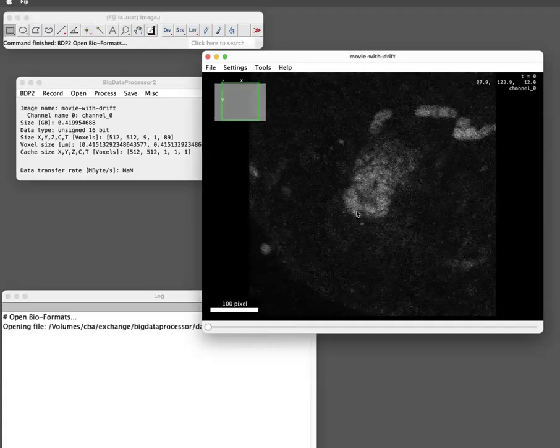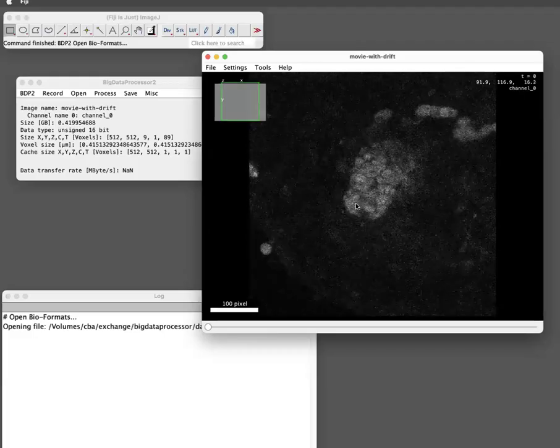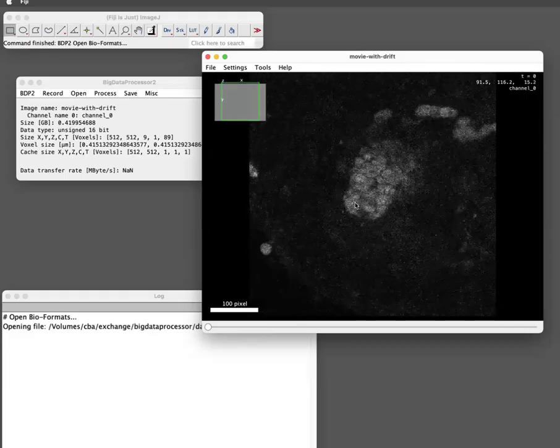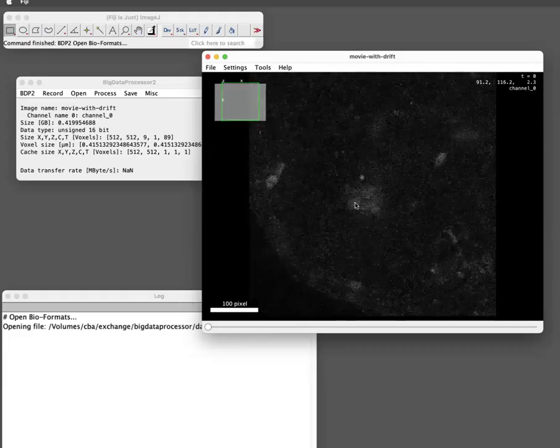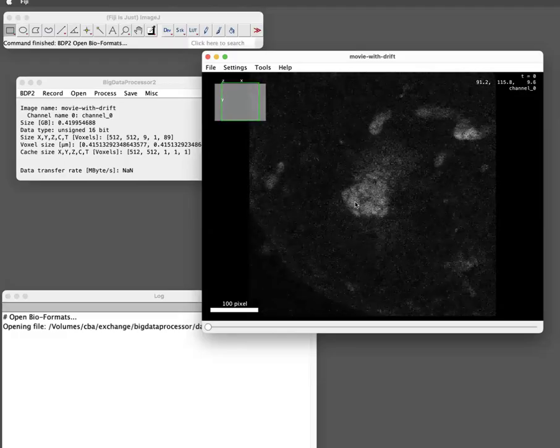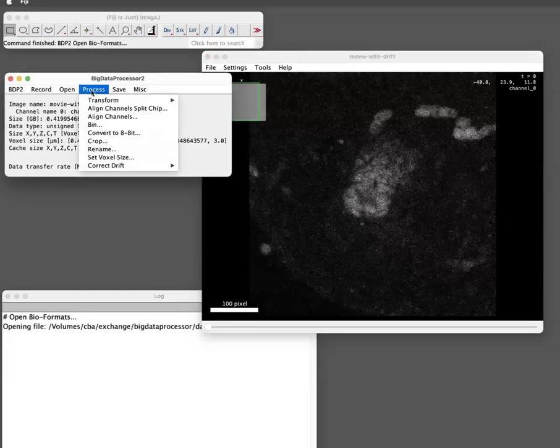This is actually a z stack. So you can see this up here. We are now at z position 12. In Big Data Viewer, which is the viewer here, you can use the mouse wheel to move, and we will also try to correct the drift in 3D. So that means I have to now first find a plane where I think my reference is. So I will do this only roughly here to save some time. I would say maybe, let's say this is the tip, right? So then I do now process, correct drift, create track.